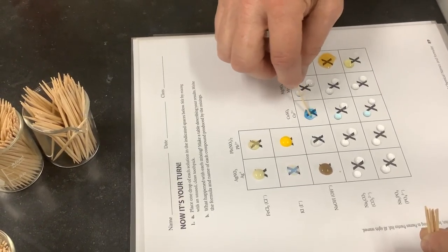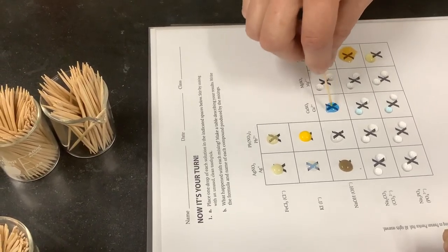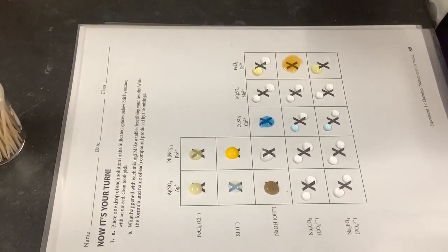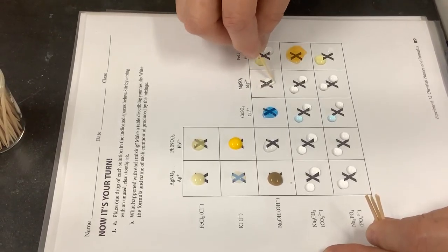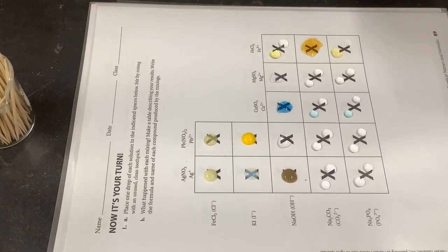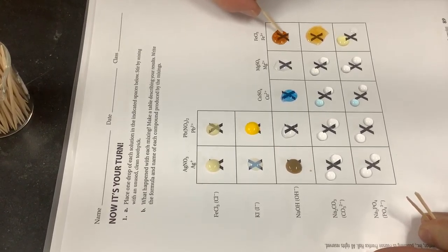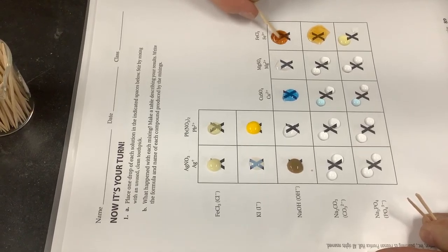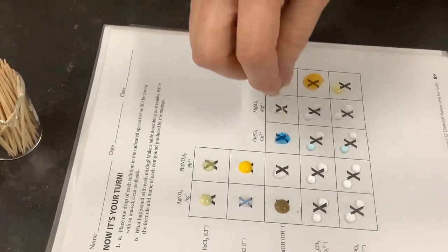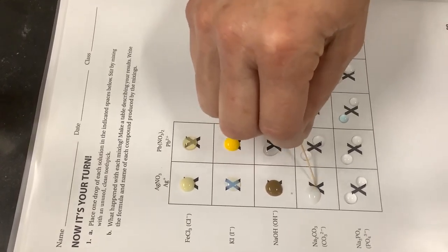Watch the lead nitrate now — you'll see a pretty white precipitate develop. On the next one, copper is turning a more intense blue and kind of gelling up. Magnesium sulfate and sodium hydroxide should make magnesium hydroxide, also known as milk of magnesia. I probably need a higher concentration of magnesium — tenth molar — to get a really obvious precipitate.